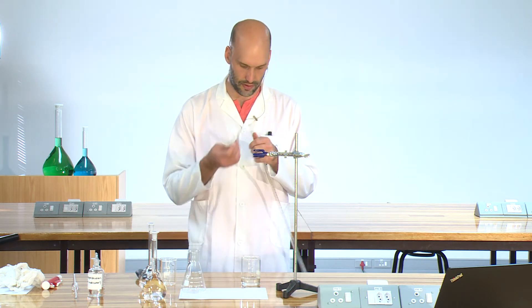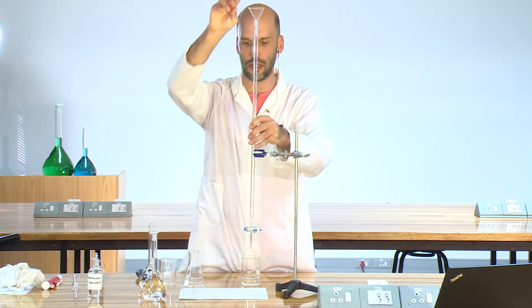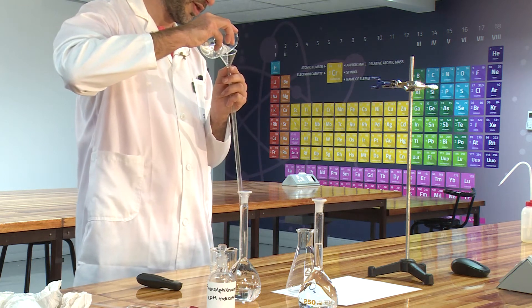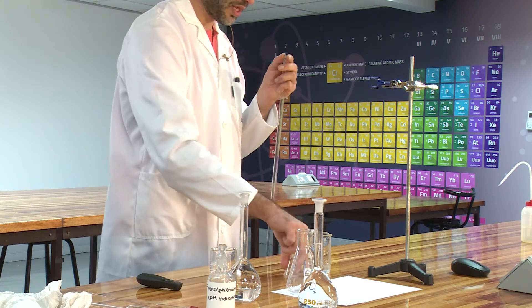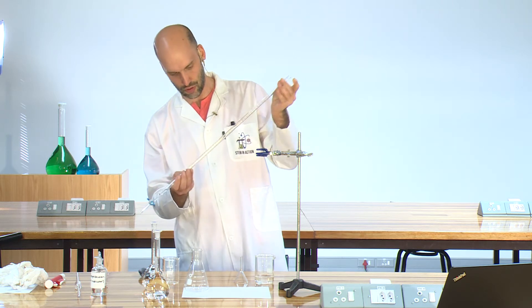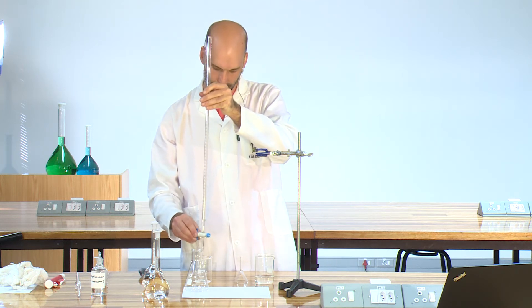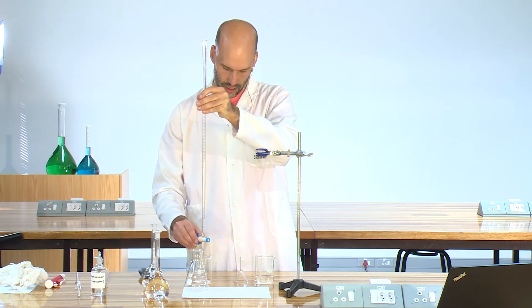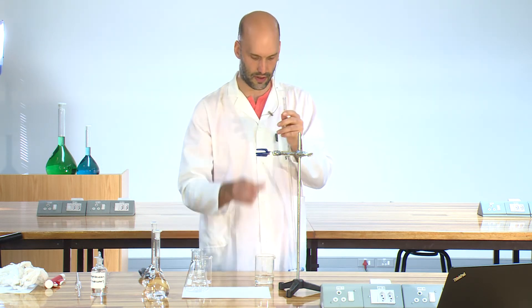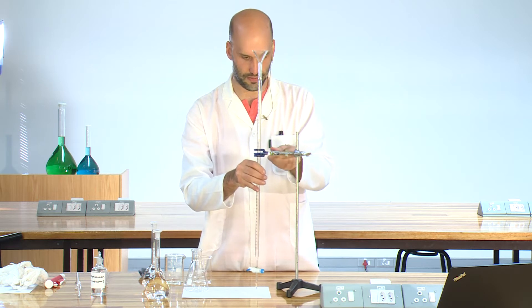I am going to pour a little of my standard solution in. Take the funnel so that we can swirl it around, making sure it is nicely clean. We are going to let it drain out through the tip to get everything out and clean. Then we fill it up and place it back in the buret holder.